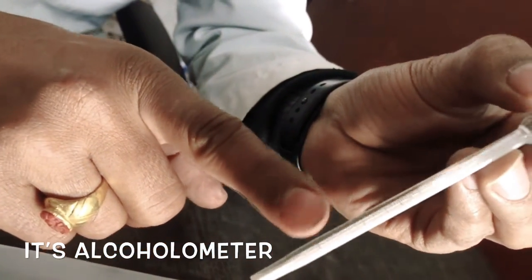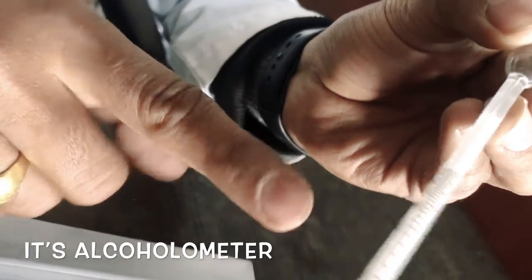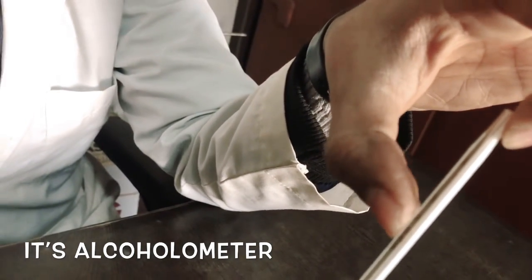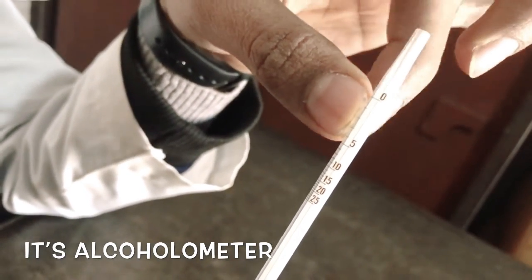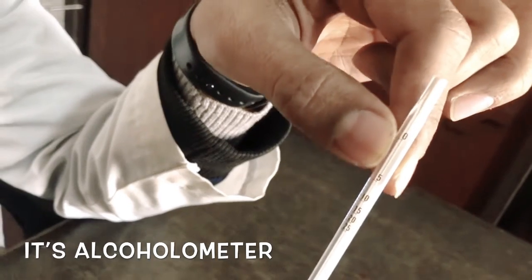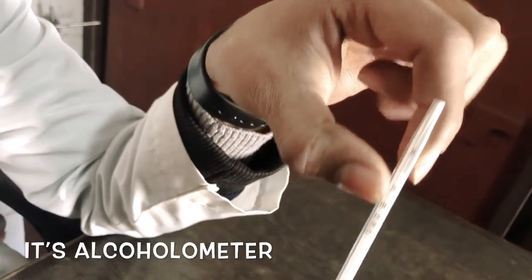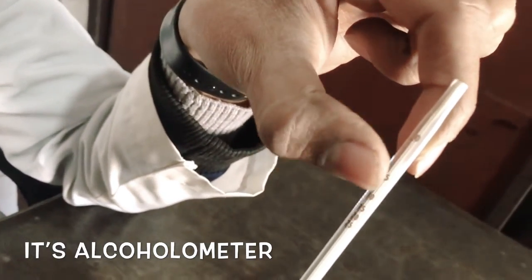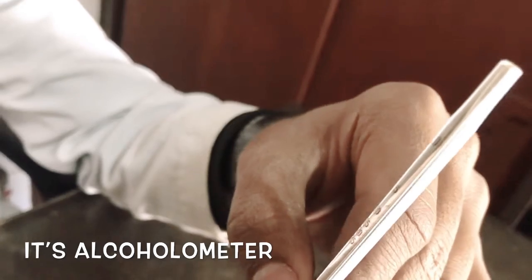The reading is inverted — it goes like 0, 1, 2, 3, 4. These numbers denote the percentage. When it reaches a point, there is one column, like the column in a thermometer, which shows the reading. So whichever point the column reaches, that is the percentage — for example, if it reaches here, it denotes 10%. This instrument can measure up to 25%. So up to whichever mark the reading shows, that is exactly the alcohol percentage in our sample.